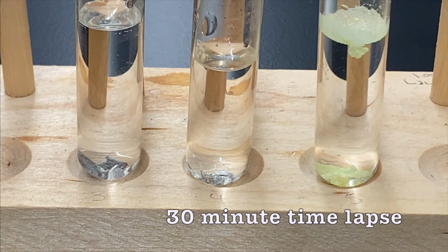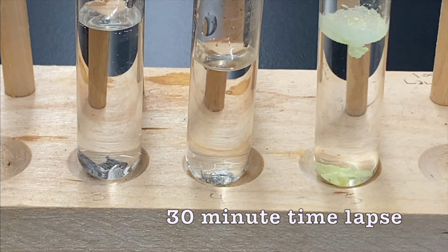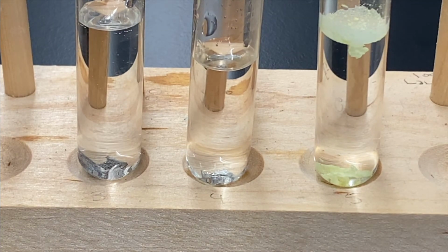All right, so this is a 30-minute time lapse. Really not seeing much going on. You can look and see bubbles on the surface of some of the metals, and we'll probably get a closer look in a sec as well.